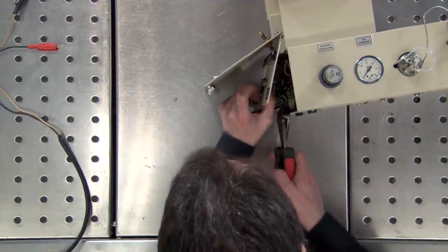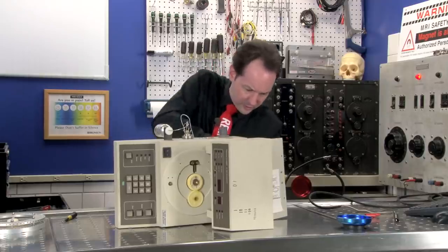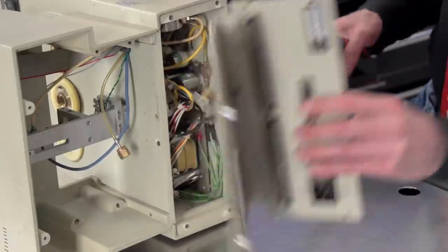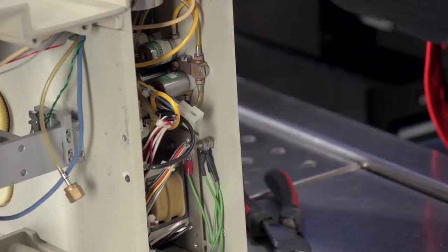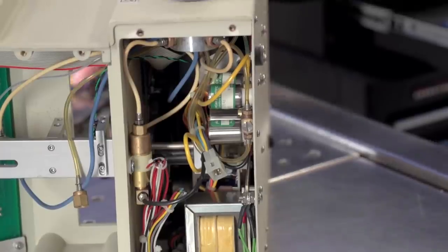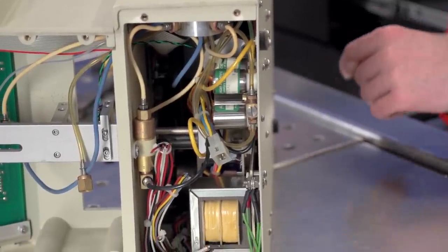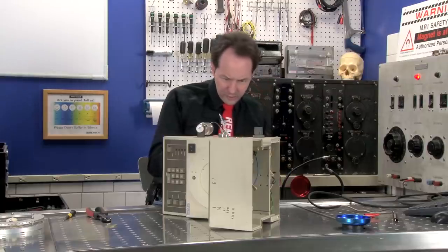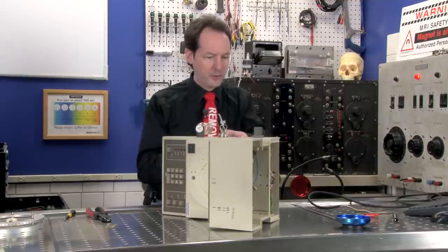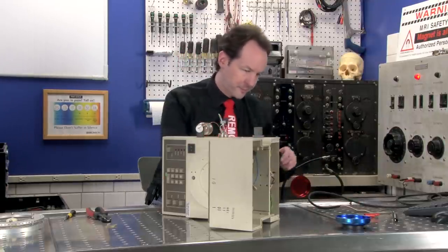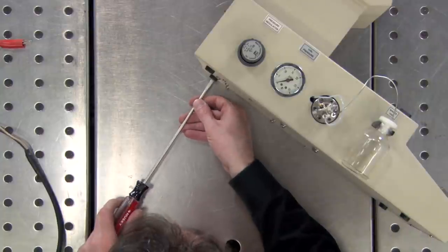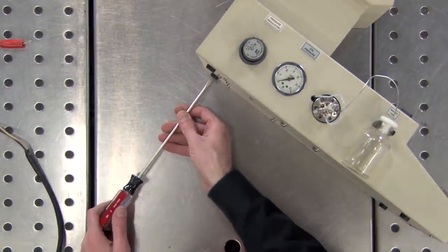There's a lot of screws on the bottom. Oh, there's some cool bits. This is going to be fun. This is more fun than I was expecting. There's some exciting stuff in there. I don't know anything about chemistry. But I've taken apart quite a few pieces of fun chemistry equipment. And that tends to end well.